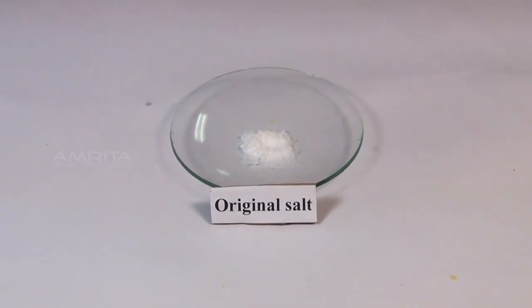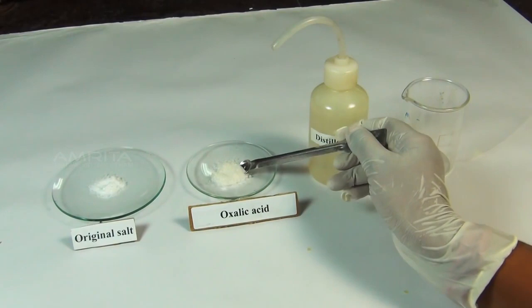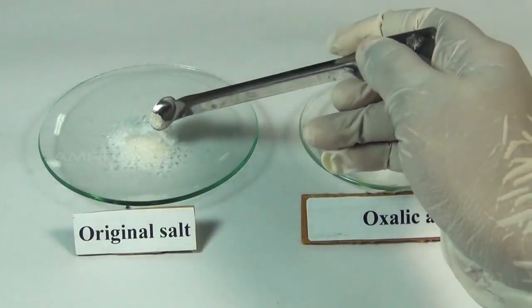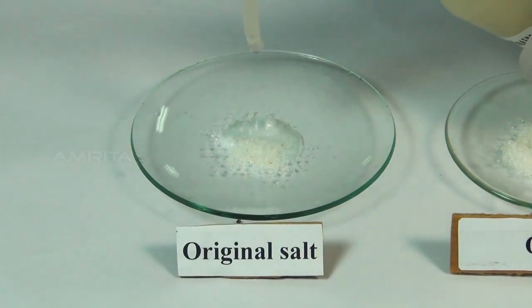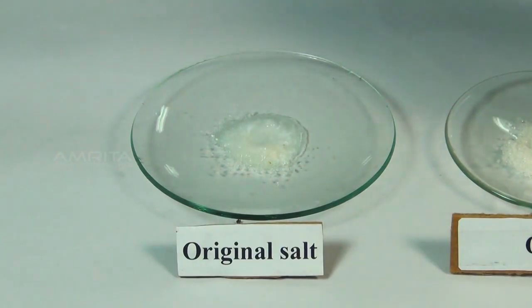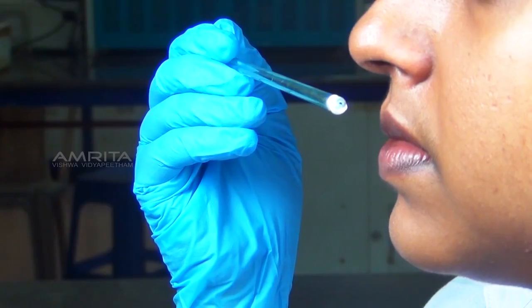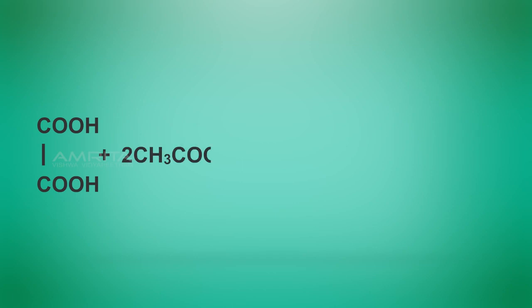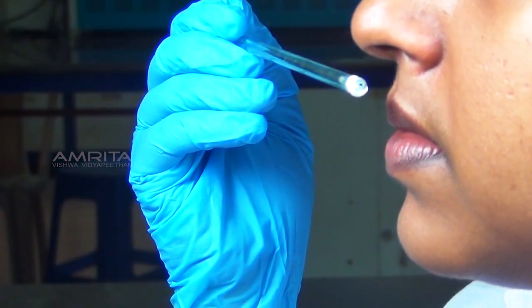Procedure: take a small quantity of the salt in a watch glass. Using the spatula, put a small quantity of solid oxalic acid into the salt. Now, add a few drops of distilled water into the mixture so as to get a paste. Take the glass rod and rub the paste with it and smell it. Oxalic acid reacts with acetate salt to form acetic acid, which produces a characteristic vinegar-like smell.